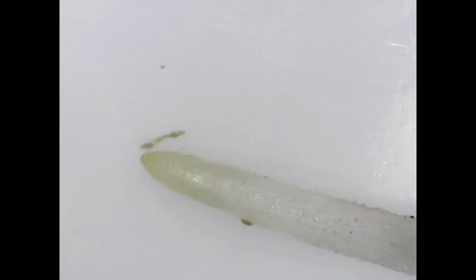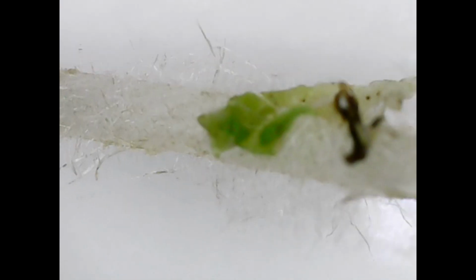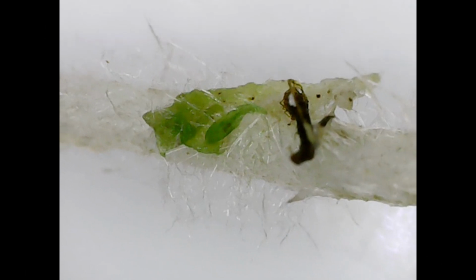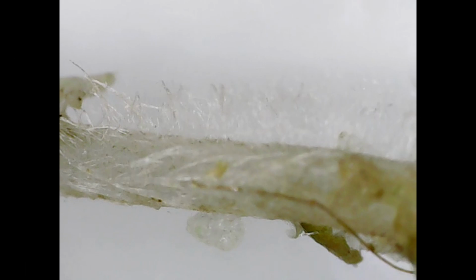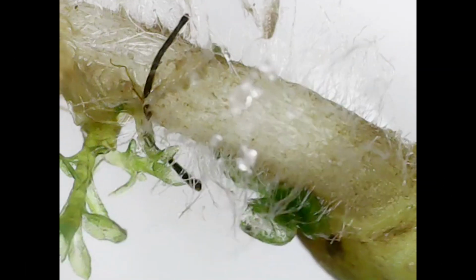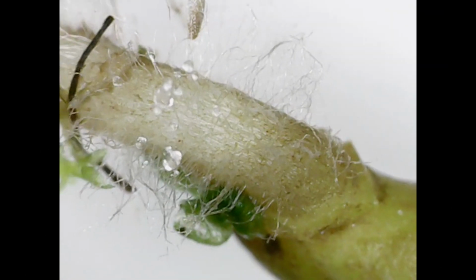And here again, we're looking at a root, and this is a water root if I'm not mistaken. You can see the tip there, you can see different elements, you can see those hair-like structures that are still kind of part of the roots. And obviously when we're repotting, some of those might get damaged because there's only so much we can do to salvage it. The green that you're seeing on here is some sphagnum moss that was attached to it, possibly even some algae. But you can see all those little fibers that are getting caught up within those little root fibers as well. And you can see a tiny bit of moss there as well.